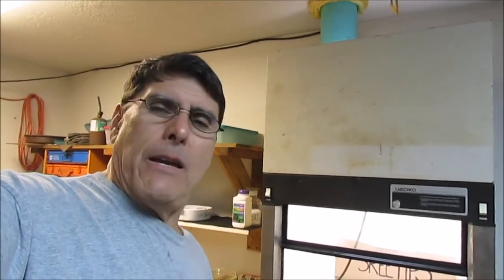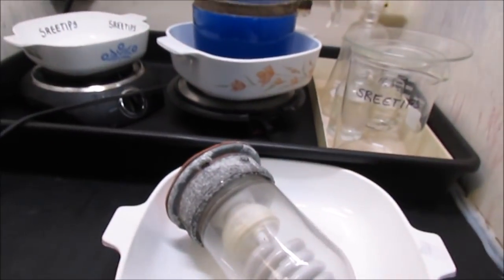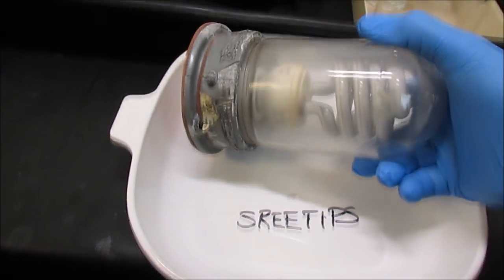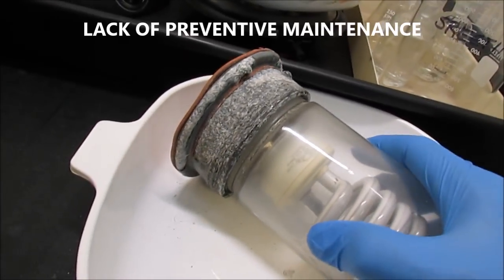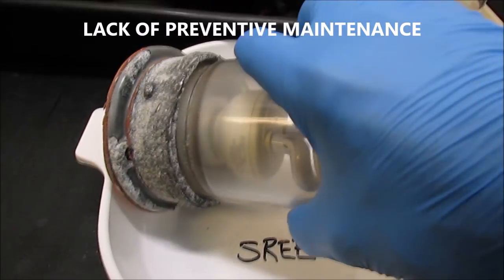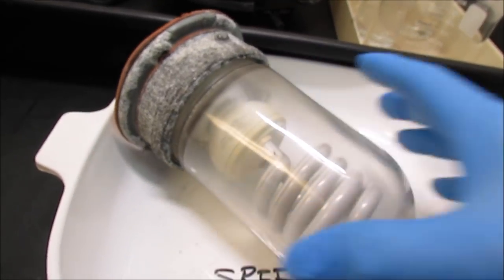Anyway, I made a modification to my Fume hood here, and I'd just like to show what I did. What I had was the motor burn out on it a while back, and I had to replace the motor, and I had this light installed in the top of the Fume hood, and you can see here from being in the acidic fumes, it started to exfoliate. I think it was aluminum with some enamel paint on it, but I couldn't even get it off of the threads there to change out the light bulb.